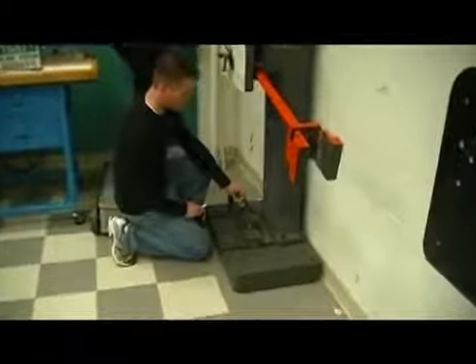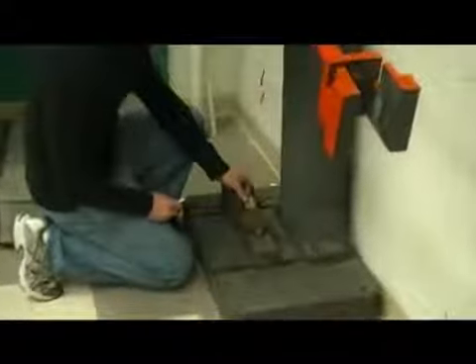Sliding the jig from the left side to the right, it will lock into place. Taking the sample, with the notch in the sample facing the peg in the jig, align the two, pushing the sample firmly up against the Charpy machine. Removing the test jig, the sample is now properly aligned to begin our first test.